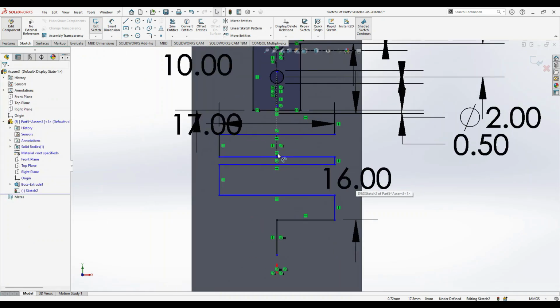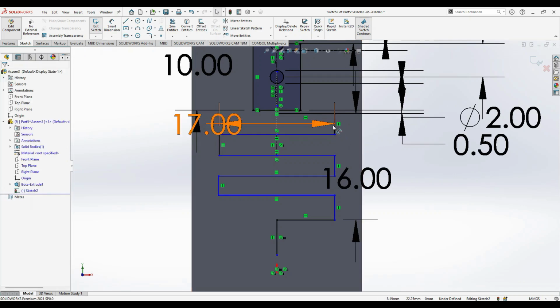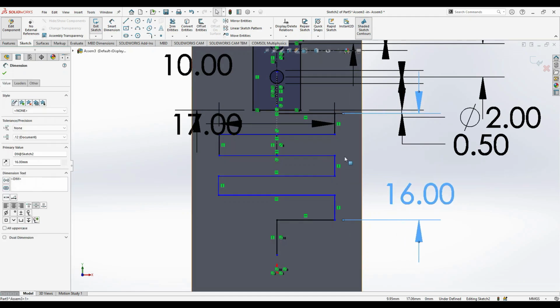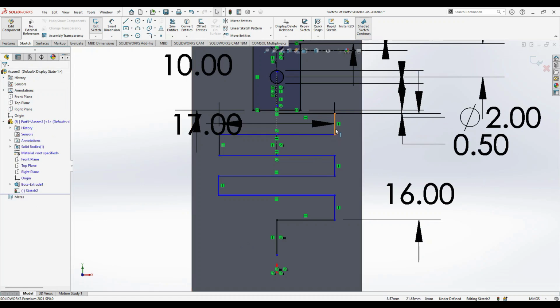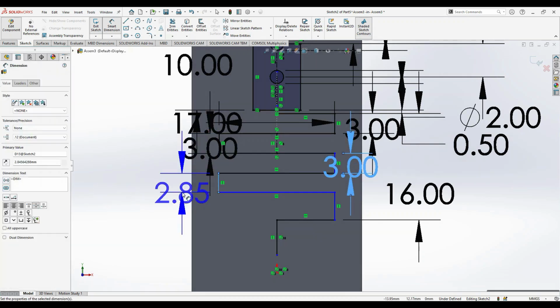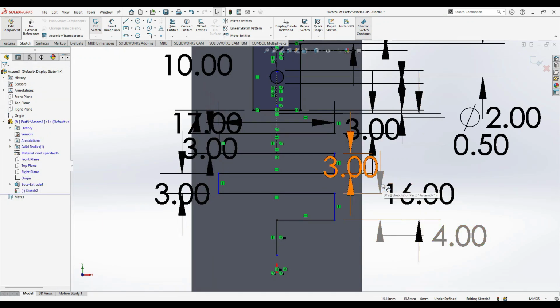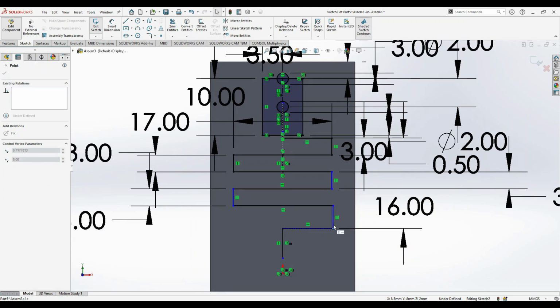Okay, now 16 mm is fixed, so we have to arrange them equidistant. So you just click this and, okay. 1, 2, 3, 4, 5. Let's say 3 mm, and try to do it as 3 mm, 3 mm, 3 mm, and this is again, but it's not taking, so finally it should be. So we'll try to adjust all the channels in a length of 16 mm.